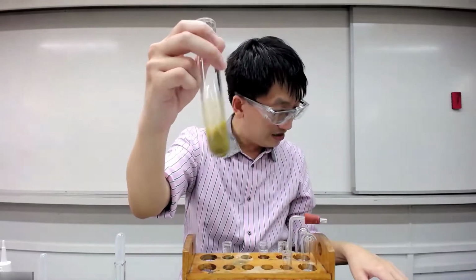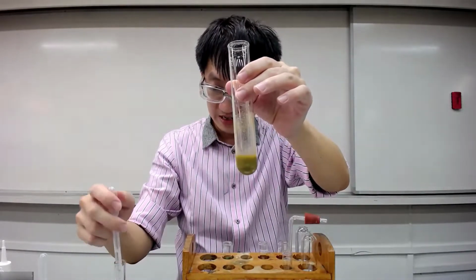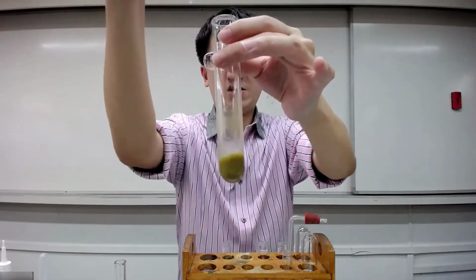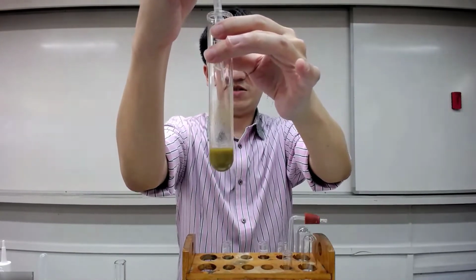And then after that, they ask you to repeat until it's empty. So we'll try to do that. We'll keep doing that, 1 cubic centimeter, bits and pieces of it. So I'm going to hold this ammonia. I'm going to add in drop by drop slowly. I want you to see the difference.